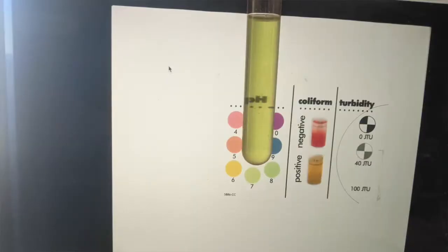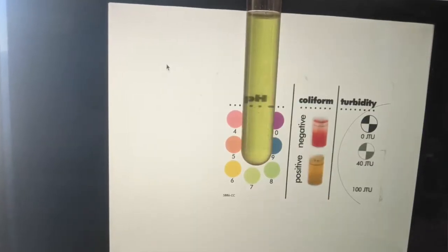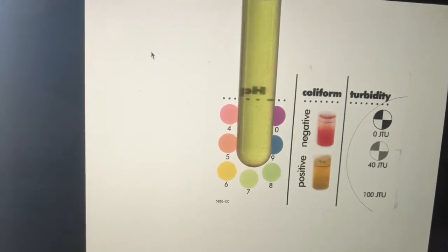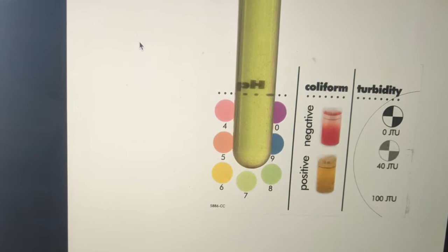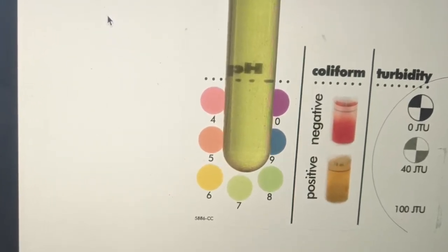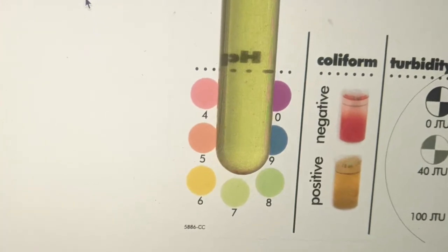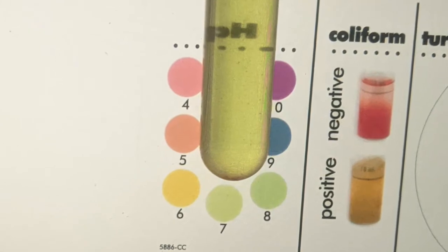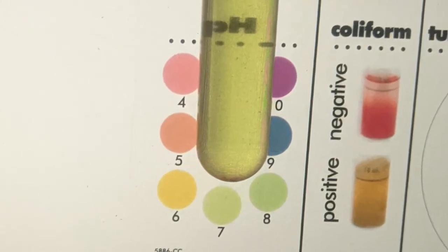It works really well if you take the tube and lay it right in the middle, where the numbers on the chart go from 4 and then up to 7 and then up to 10, like that in a U shape. There's an empty space in the middle that's perfectly test tube sized. So that's where you're going to put this to read it and to determine what the pH is. Okay, so my pH lined up pretty evenly with the 7 color.